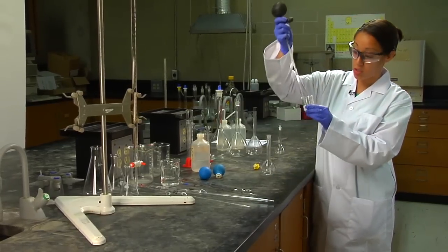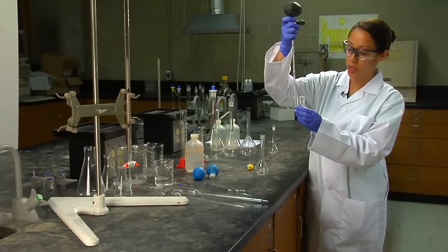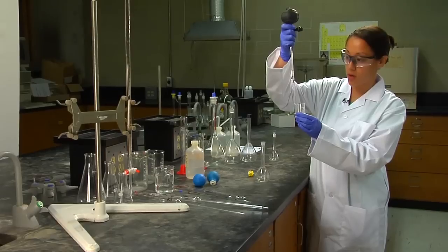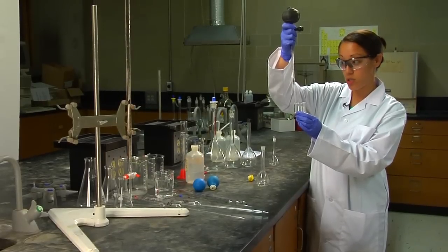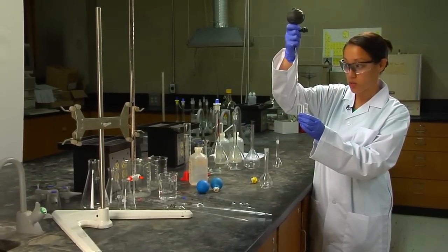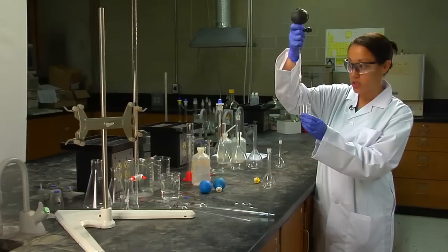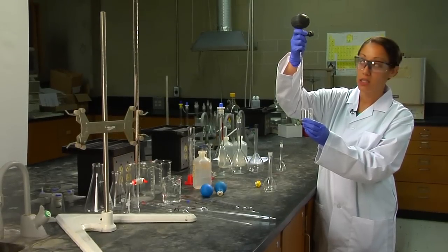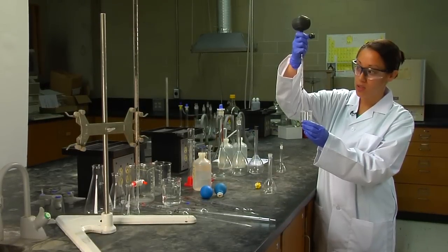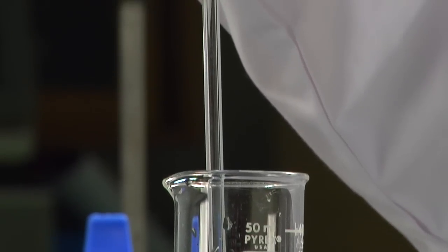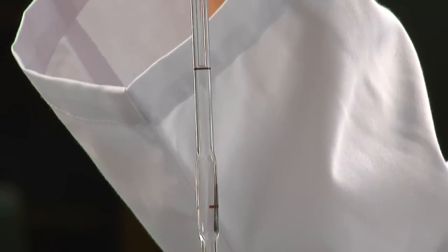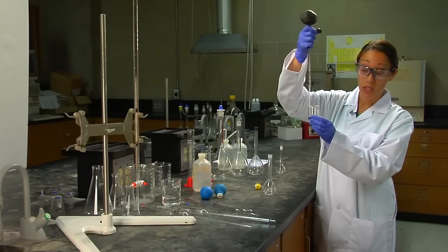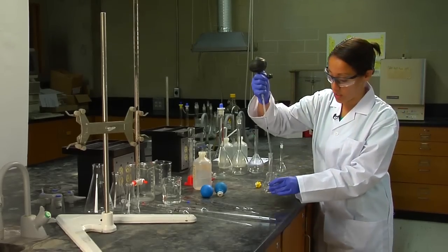Make sure your tip is submerged in solution. You press S and as you can see the volume or the solution is going up the pipette, very controlled. You want to make sure that the tip of the meniscus—sometimes if you go too far that's okay, you can push E for empty to control the volume to go back down—ensuring that the meniscus sits, the bottom of the meniscus sits at the top of the line.